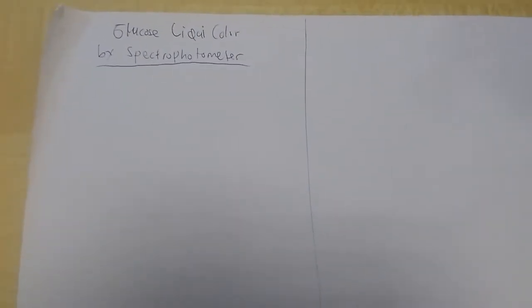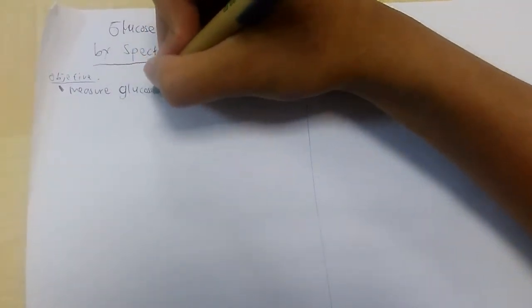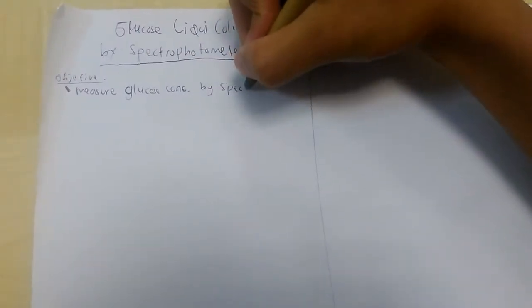Hello guys, welcome back to Made It Simple. I hope you enjoy our previous videos. Now we're talking about glucose — it's a little bit hard to spell — measured by spectrophotometer. The objective will be to measure glucose concentration by spectrophotometer.